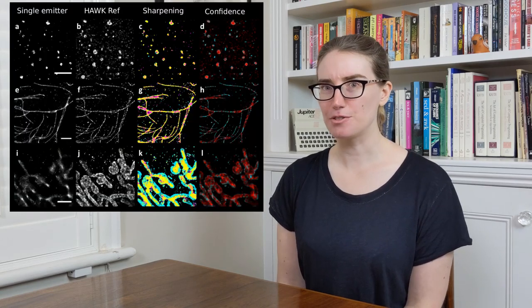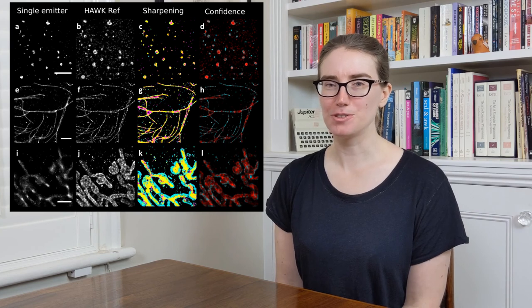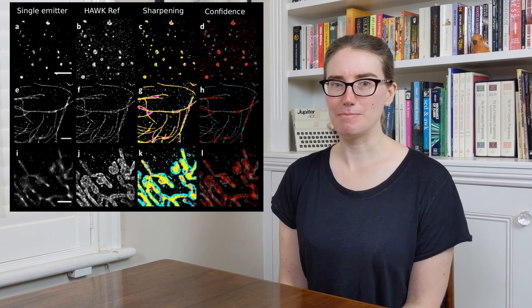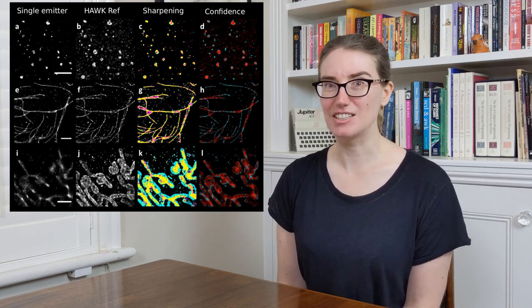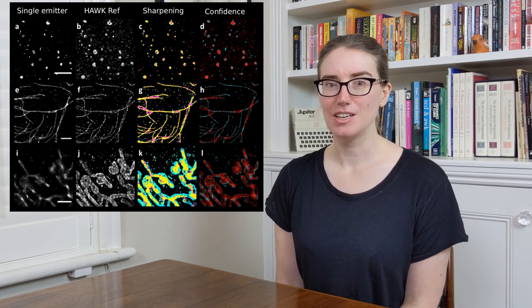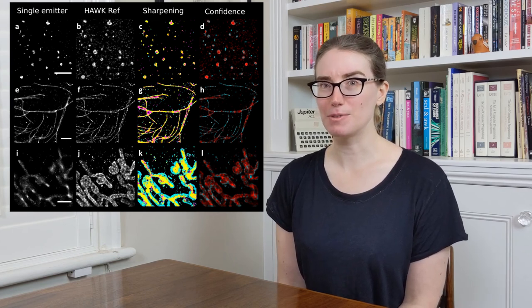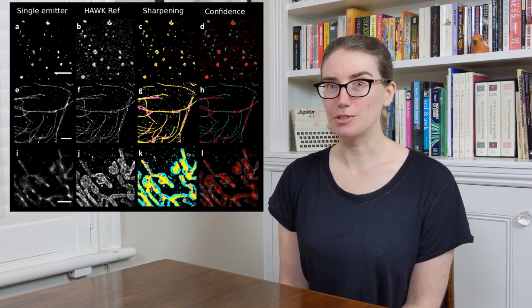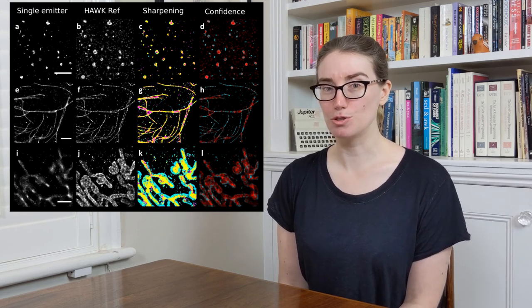We also looked at high-density data from multiple different biological structures, including clathrin-coated pits, microtubules, and mitochondria. HawkMAN is able to identify missing structure, which appears as cyan in the sharpening map, and false structure, which appears as magenta. The confidence map shows areas where the data is problematic in red. This work is currently under review, and we hope to be able to release the tool soon.